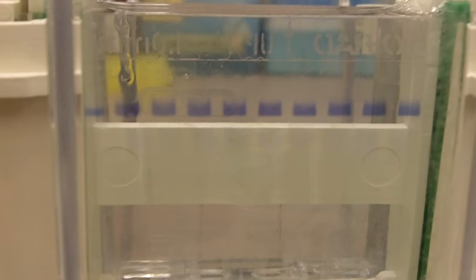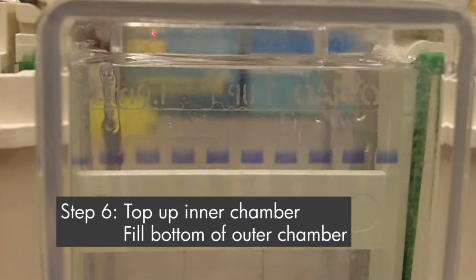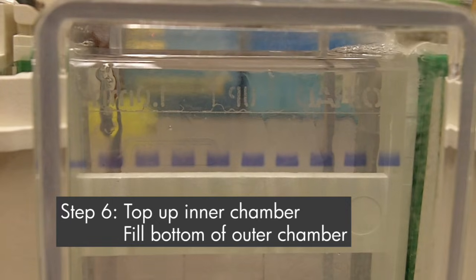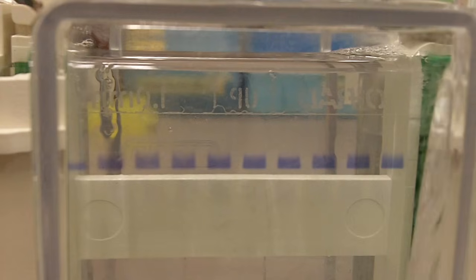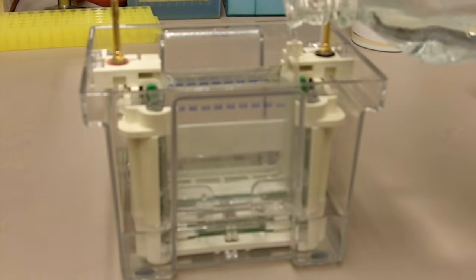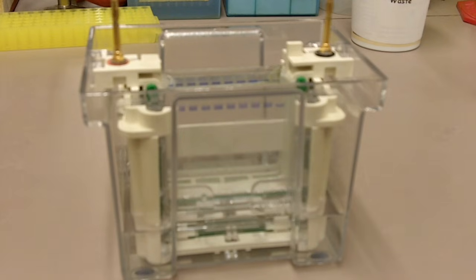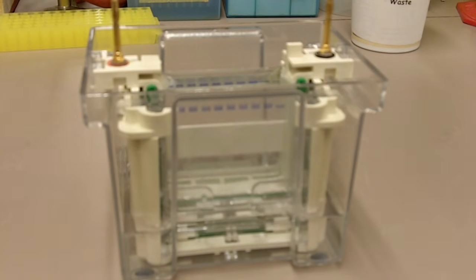After you've loaded all the samples, make sure you top up the buffer that's in the inner chamber. And then you want to pour buffer into the outer chamber just enough to submerge the bottom of the gel. Then we can get started on running the gel.